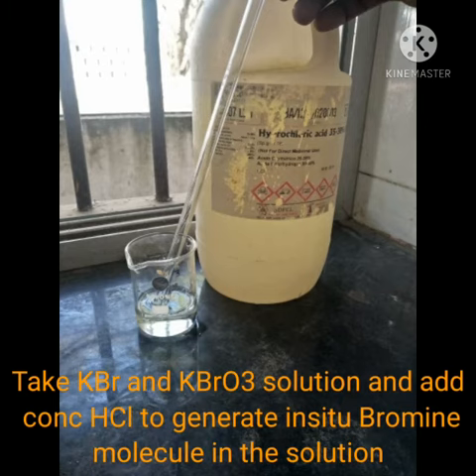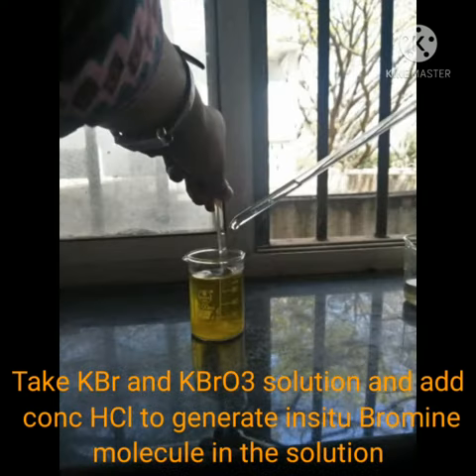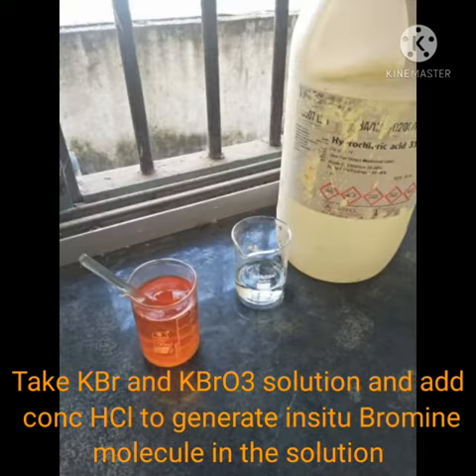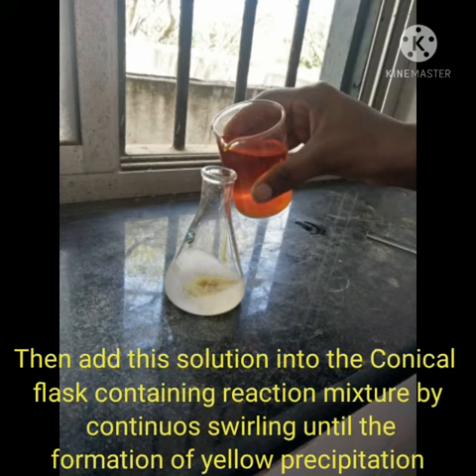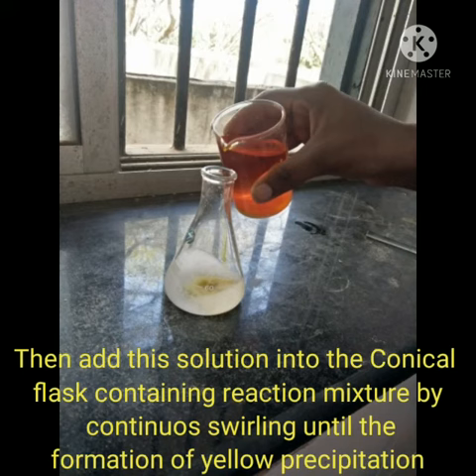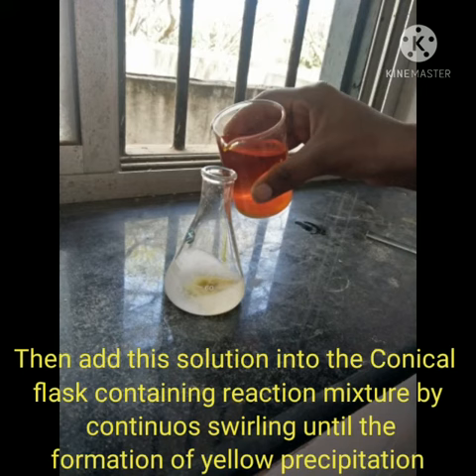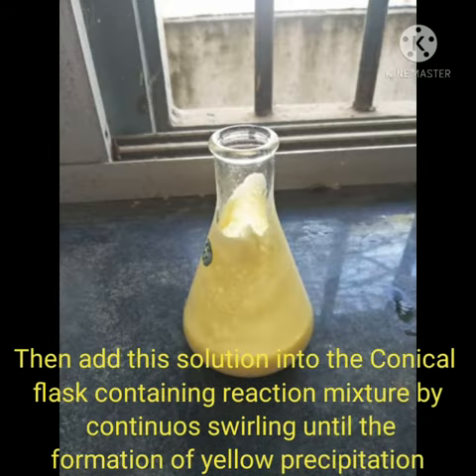Take the KBr-KBrO3 solution and add concentrated HCl to generate bromine molecules in the solution. Then add this solution into the conical flask by swirling until the formation of yellow precipitation.